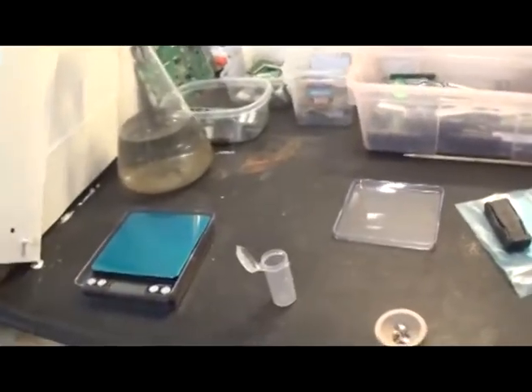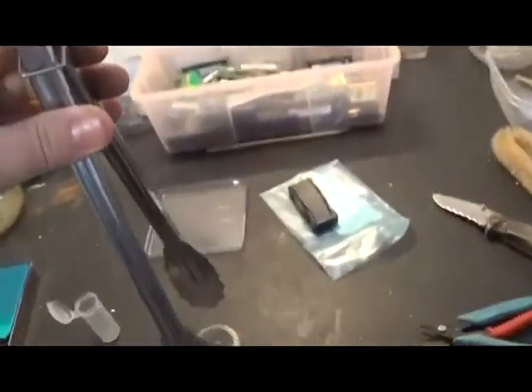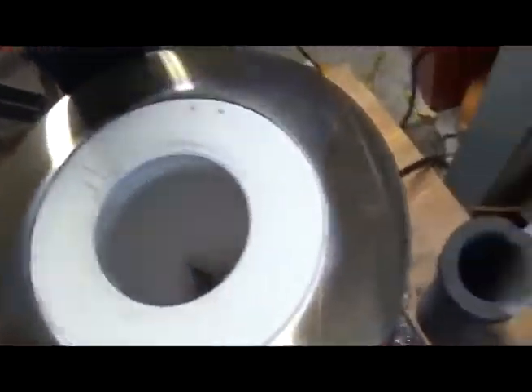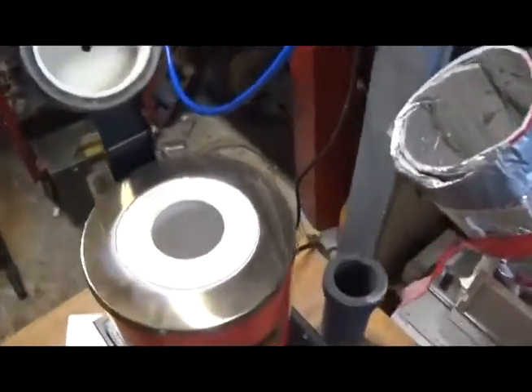The only thing that concerns me is the only way I'm going to be able to get this thing out of there is salad tosser tongs. I mean it's great but it's the only thing I got. I've seen a couple cats on the interwebs use these to get it out of the ovens, but never one like this. Hopefully it doesn't just turn to mush and melt. We'll see, but we're going to give it our best shot.